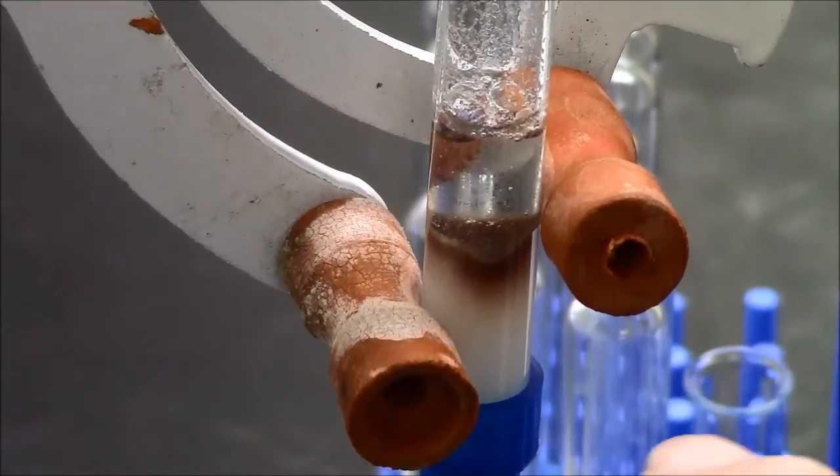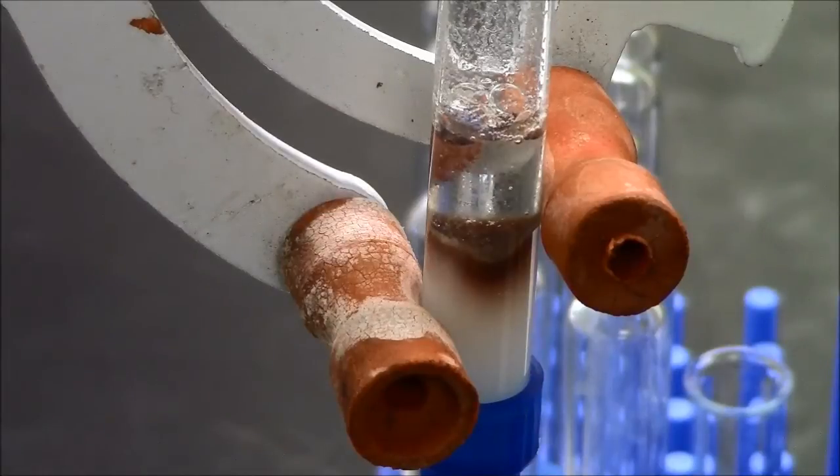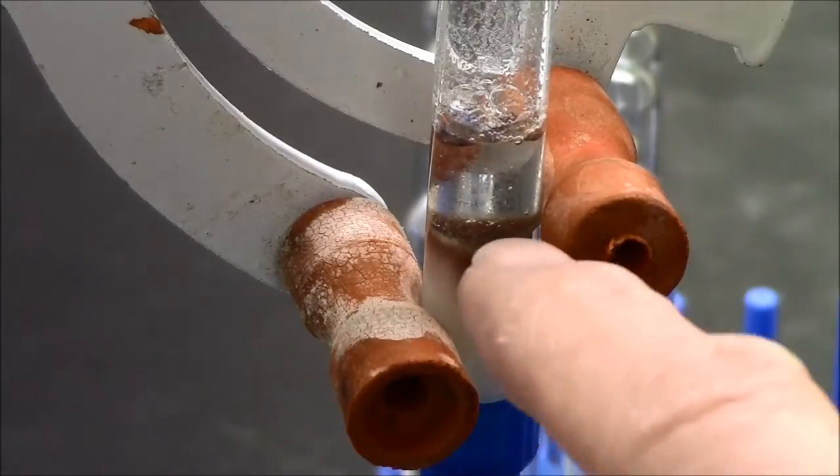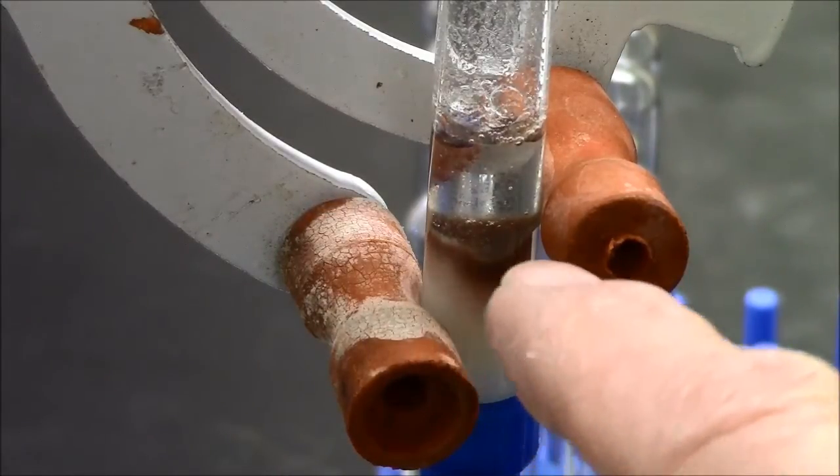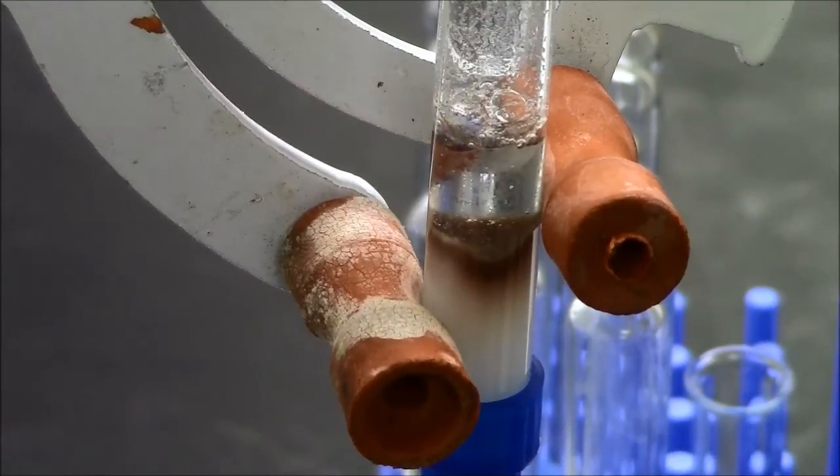So you can see here the protein appears to be concentrated at the top of the gel bed. I disturbed it a little bit here with my pipette, so I've got a little divot there, which is undesirable, but I think it'll be alright here.